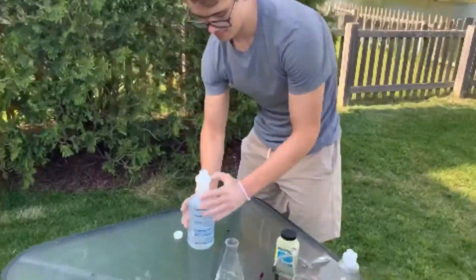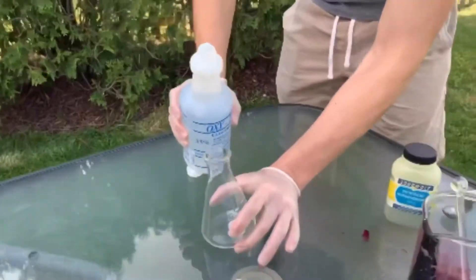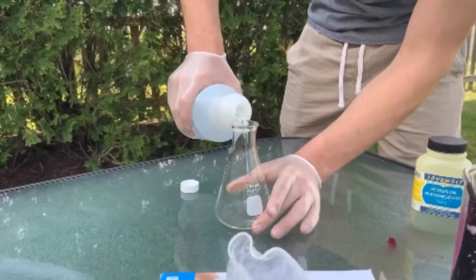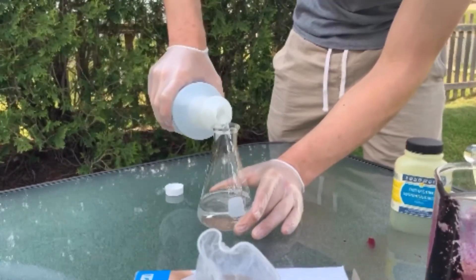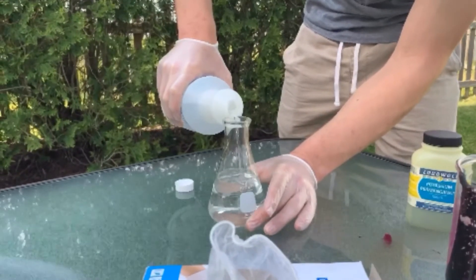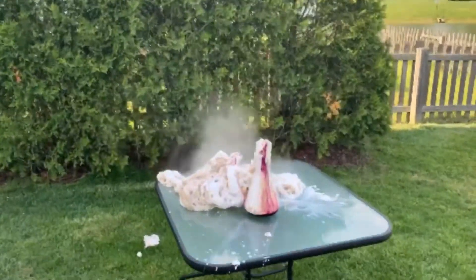Alex is going to fill our 250 milliliter flask with the 35% hydrogen peroxide, all the way up to 250 milliliters. Keep going. And go. Let's check that out.